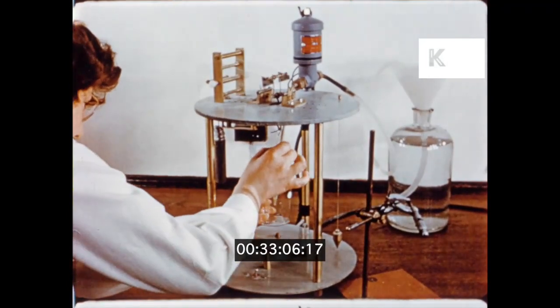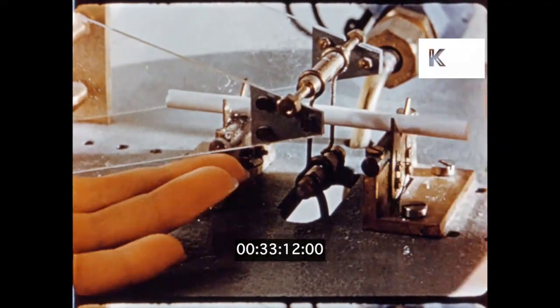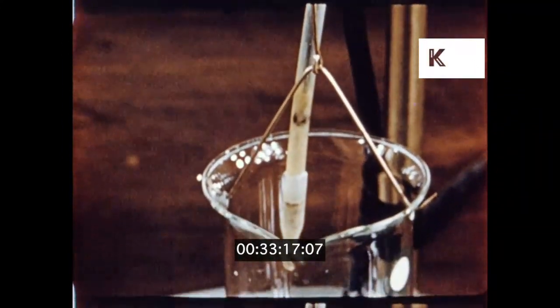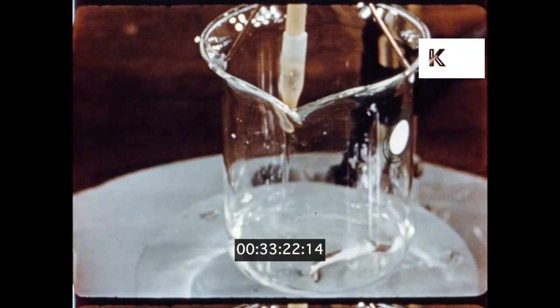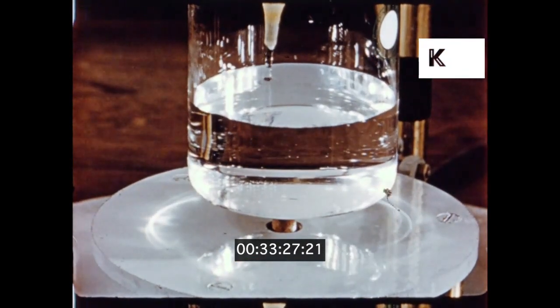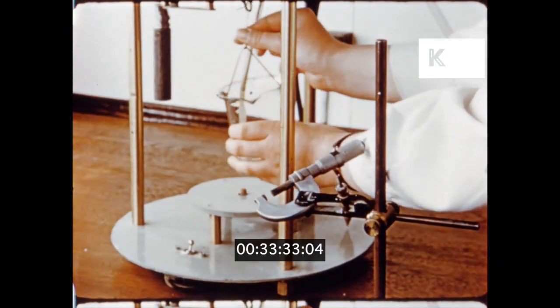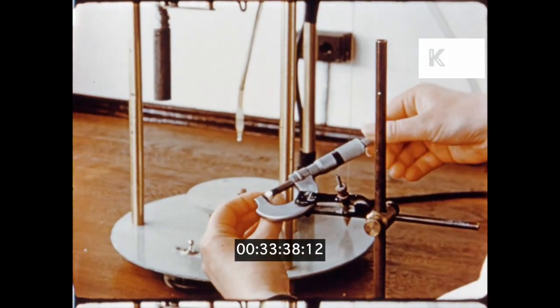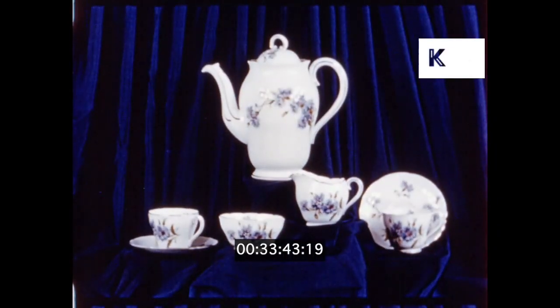This apparatus has been devised to determine the bending strength of samples of potting clays. The extruded and dried sample of the clay under investigation is supported on V-blocks and a beaker suspended from it. Water is added to increase the weight under careful control until the clay sample can no longer support the load and breaks. The beaker drops and impinges on a switch which cuts the water off. The weight of the water is measured, and so the bending strength of the clay is established. Vital statistics for the potter to make one of the best-known end products of English china clay.